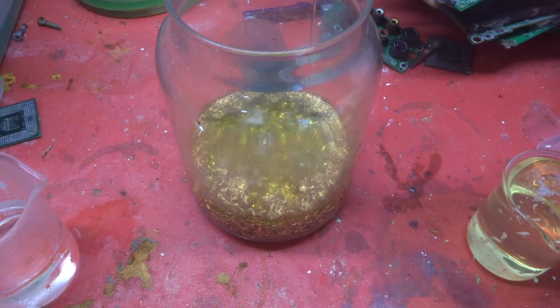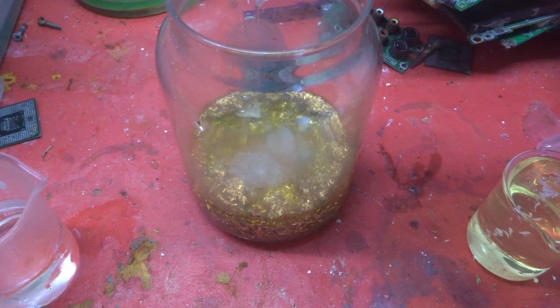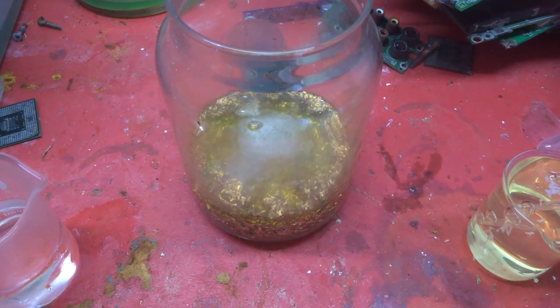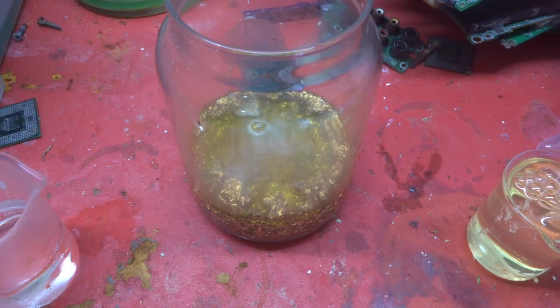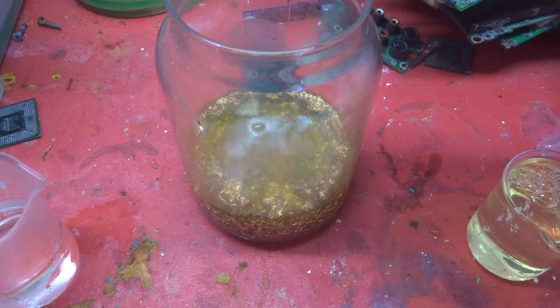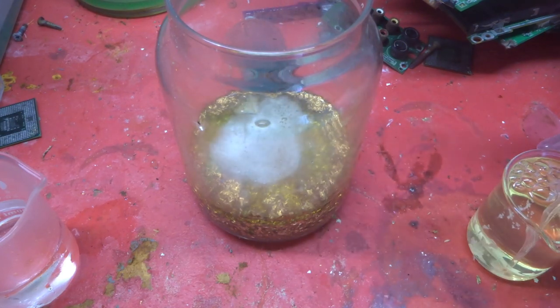I'll slowly add the next three millilitres. That's why you need to be wearing your mask or have it under a fume hood — my fume hood is very noisy so you wouldn't hear anything, so I'm keeping it out here so you can hear what I'm saying. I need to get a new motor for it. That's six millilitres gone in. I'm going to add up to nine millilitres and then leave it to work — you don't want to be watching the same thing over and over.